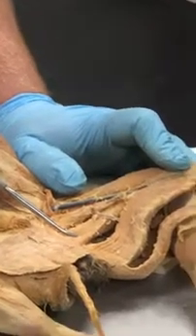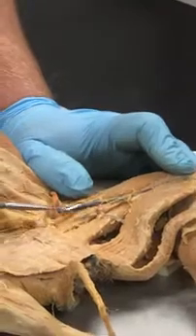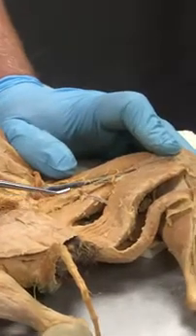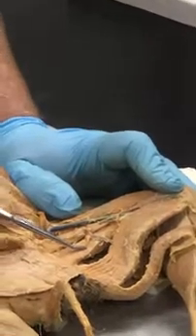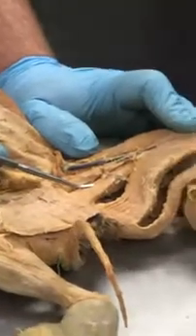Either one is fine. The one above that, or superior to it, is going to be the adductor longus. So I always get these two mixed up. But if you know that this is the semimembranosus, this is the adductor magnus, MM. So that helps you a little bit. They're next to each other, okay?